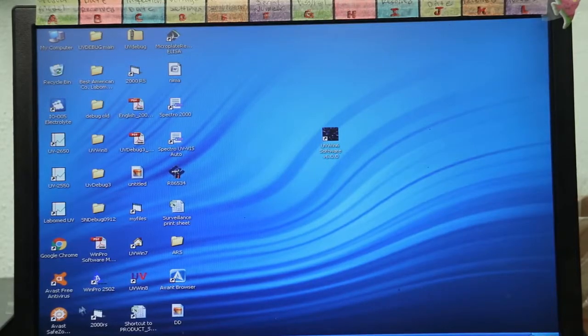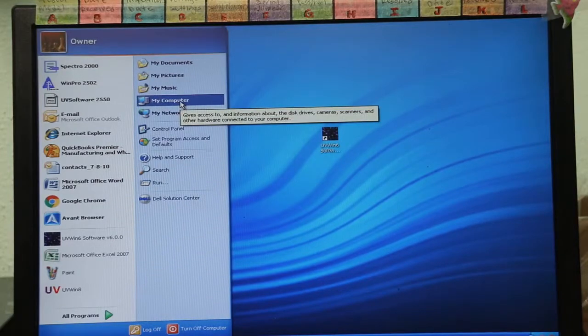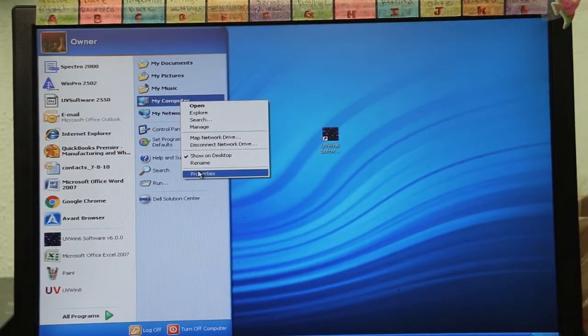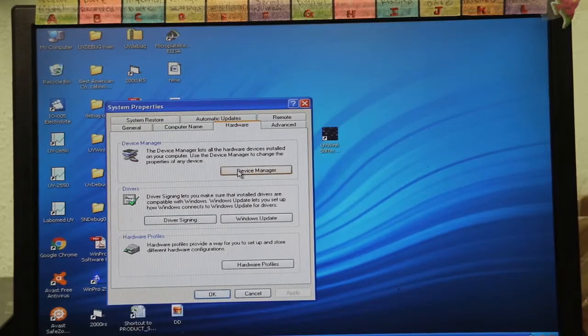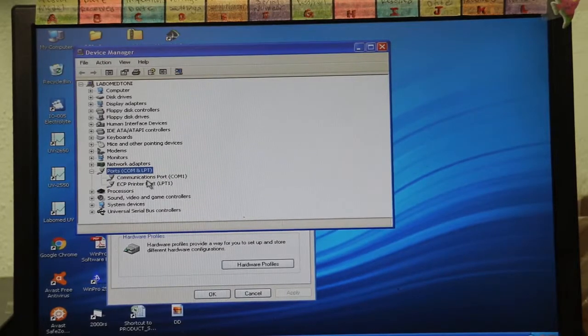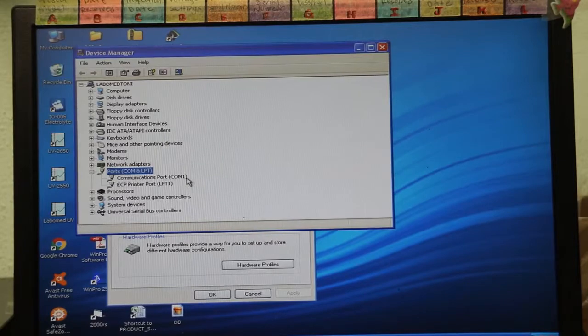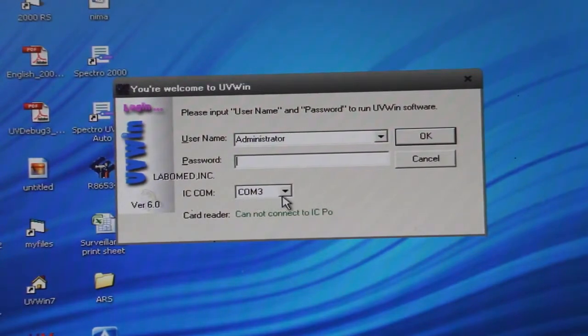To set the COM port in Windows XP, click Start, go to My Computer, right click, select Properties, Hardware, Device Manager. You'll see a tab labeled Ports. Double click and you can see that the communication port is labeled COM1. So when initializing this software, make sure that your COM port matches the COM port for the computer.